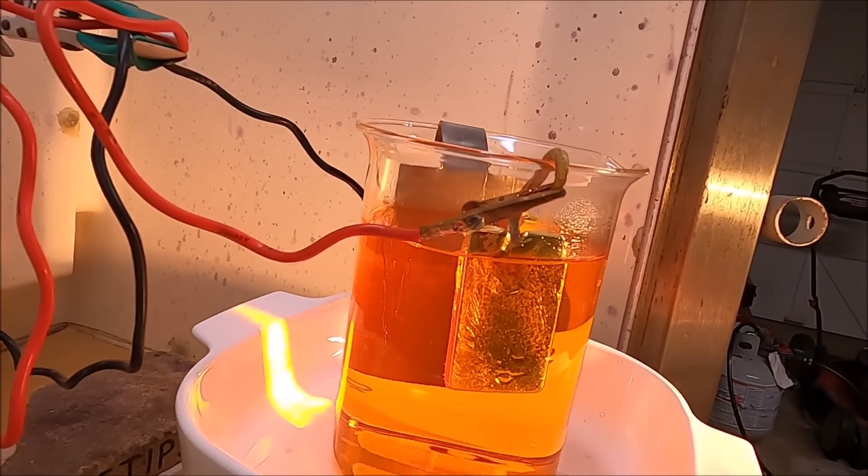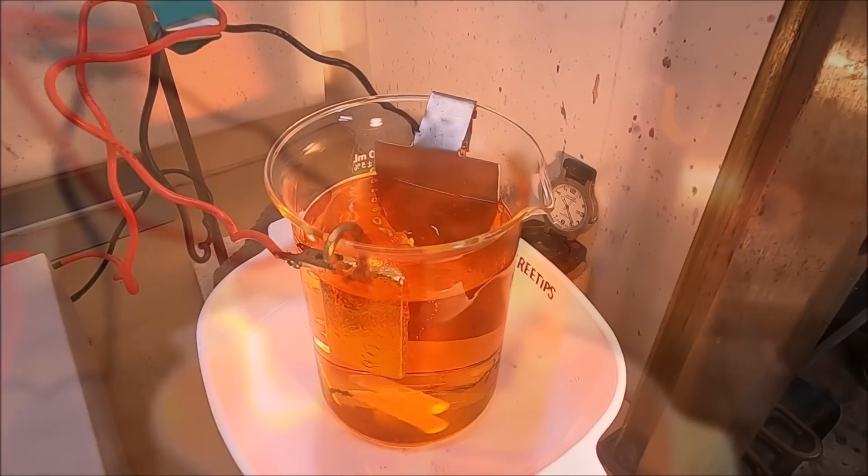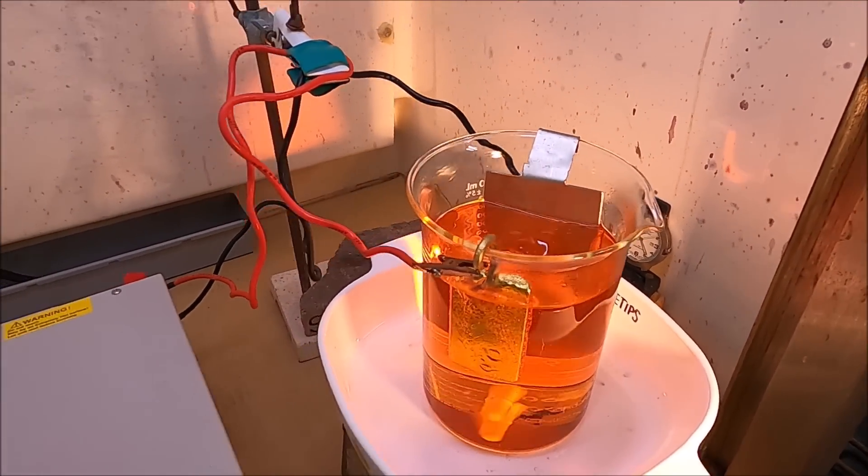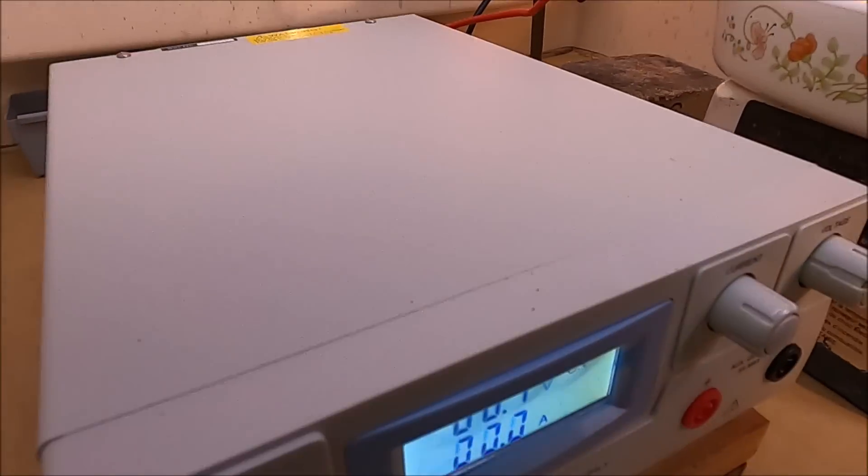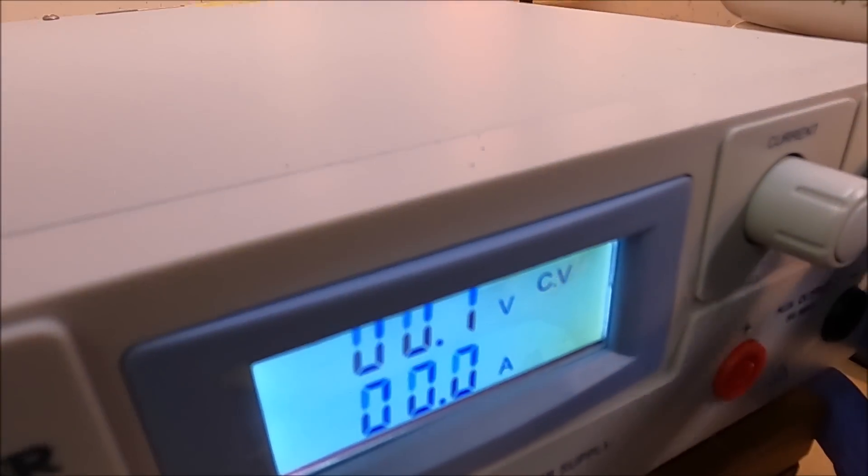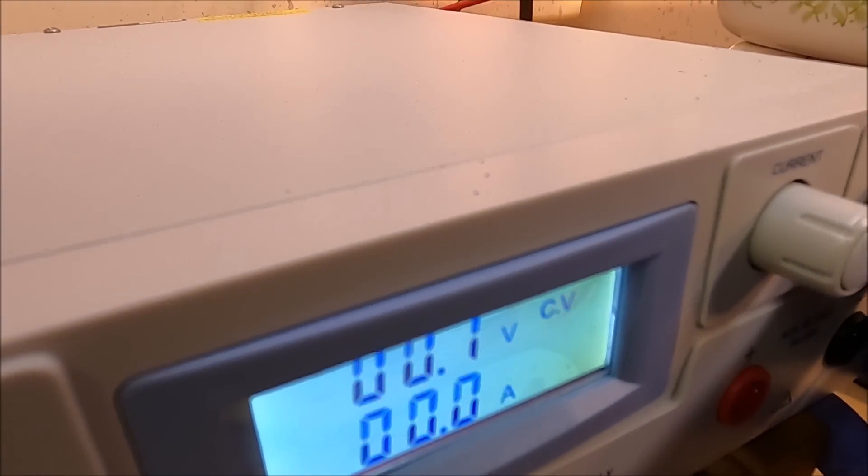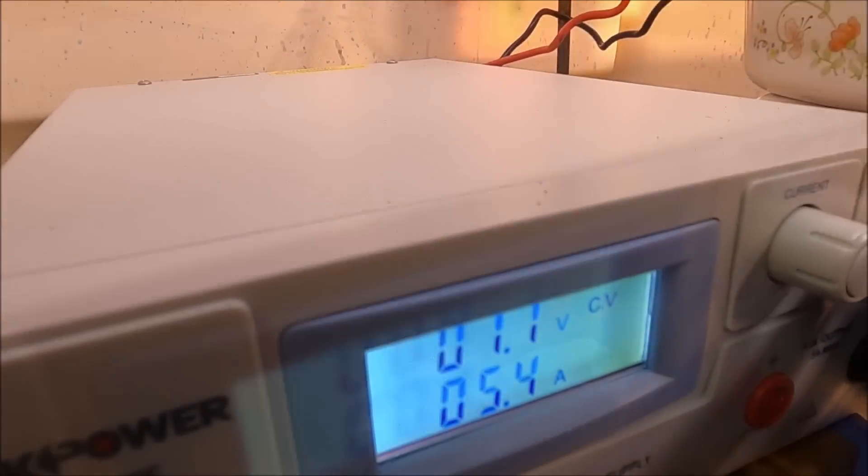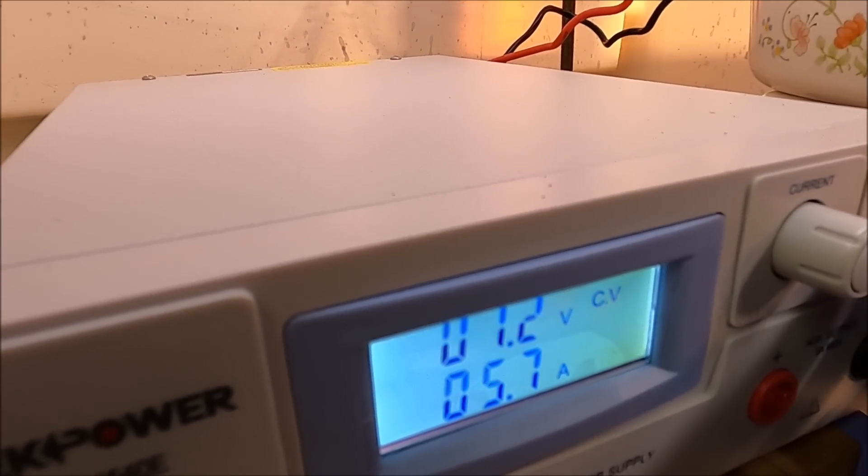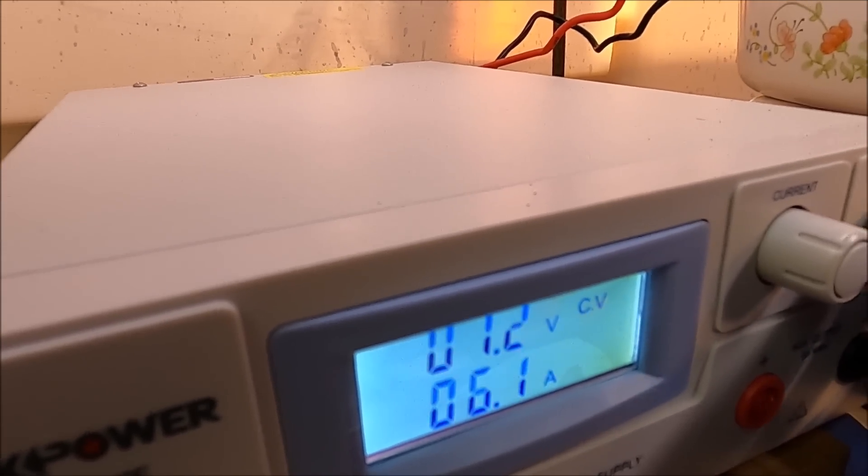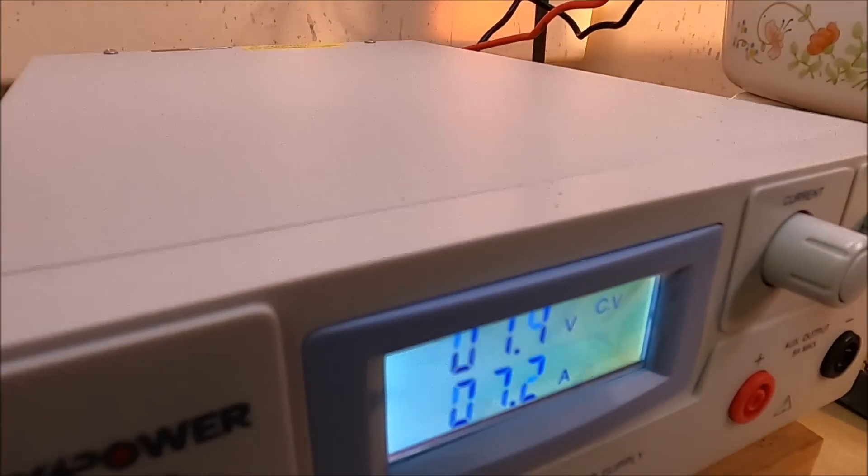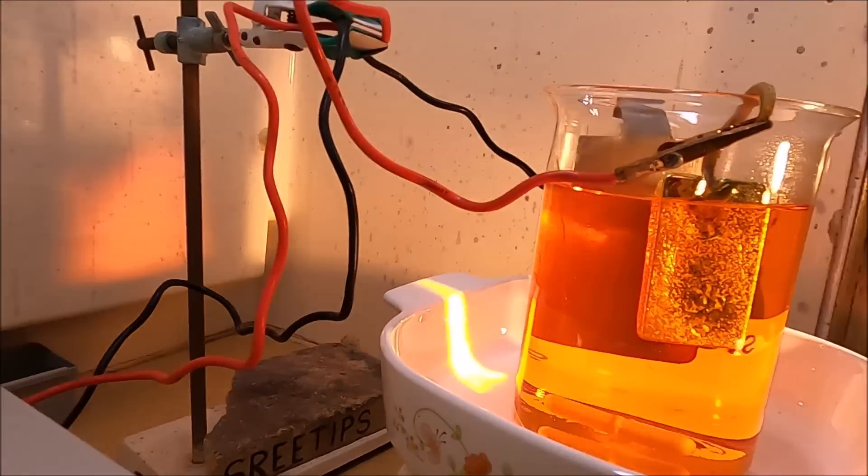I'm at 138 Fahrenheit, about 59 degrees Celsius. So now we're going to turn the voltage up slowly and see what kind of reaction we get. That's 1.4 volts, and we're pulling 7.2 amps.